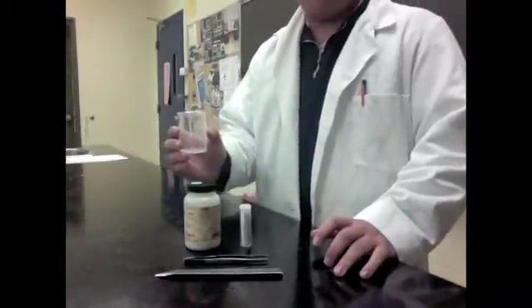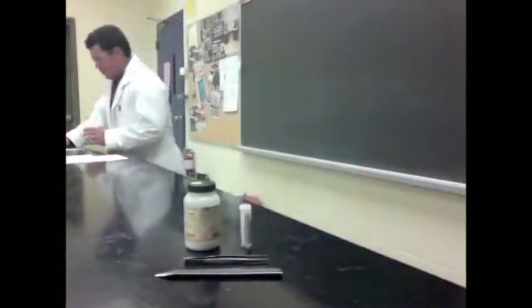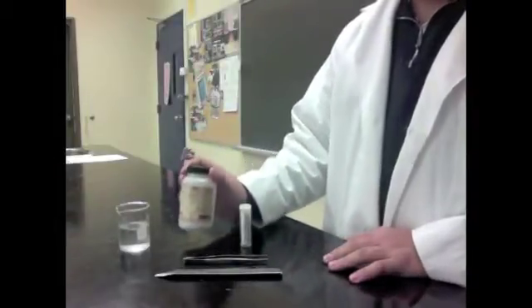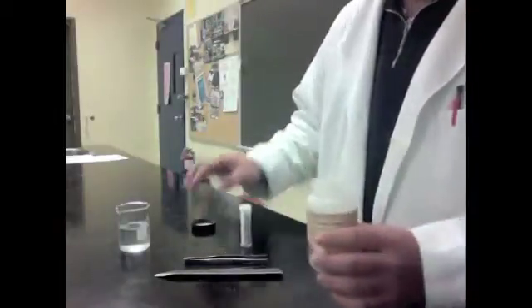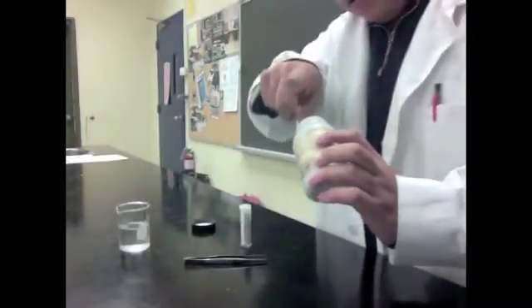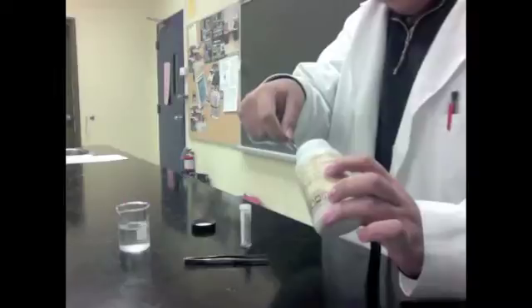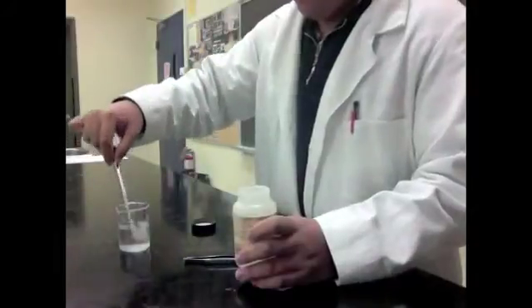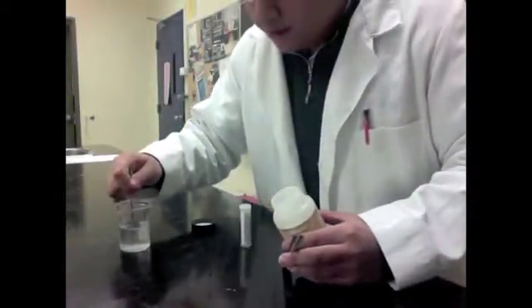So first, we'll start off by filling the beaker with water. Here we are, just regular tap water folks. Secondly, we'll be placing our calcium within the water and stirring it up a little to get it going. So here we are, my thumb on the scoop. Here we are class, this is how calcium looks like. So I'm placing it within the beaker and I'm going to simply be using my tweezers and stirring it within the beaker.